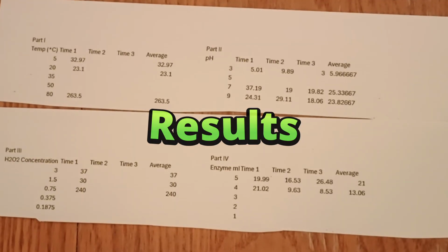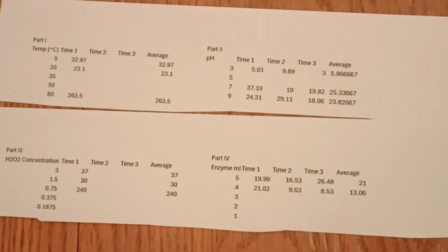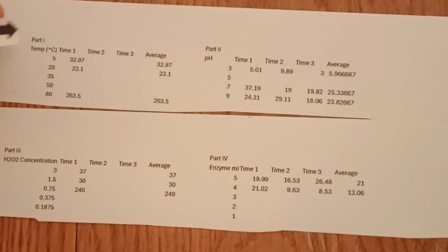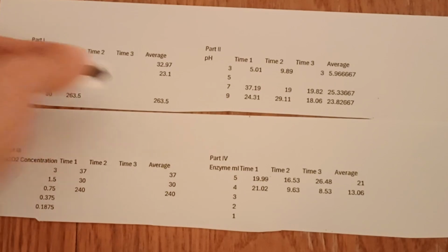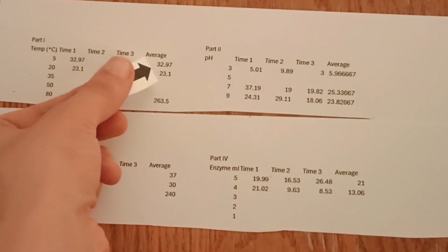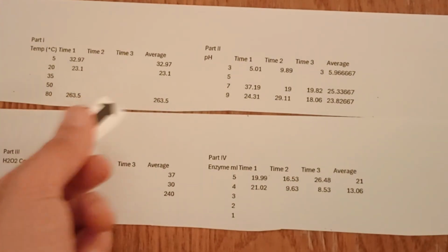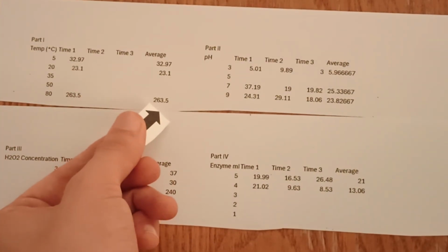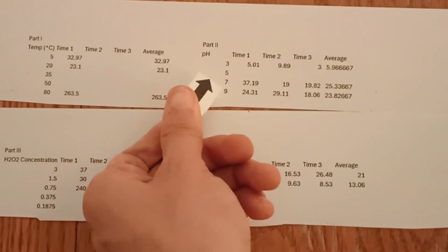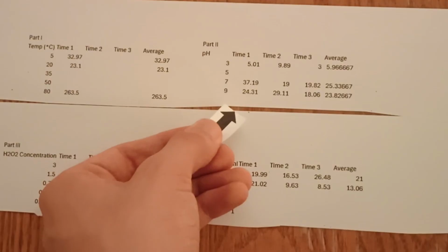After a few hours of experimenting, we finally have our raw data. For part 1, we found that at 20 degrees Celsius, the time it took for the paper to float was the lowest at 23.1 seconds. It got slightly higher at 5 degrees, at 32.97 seconds, and much higher at 80 degrees, taking 263.5 seconds.